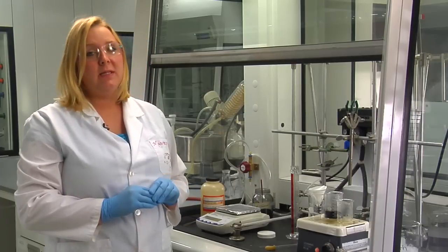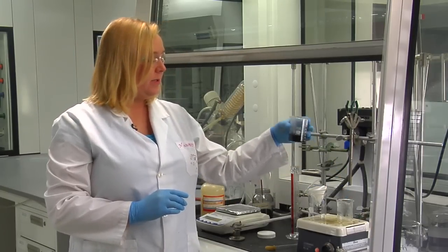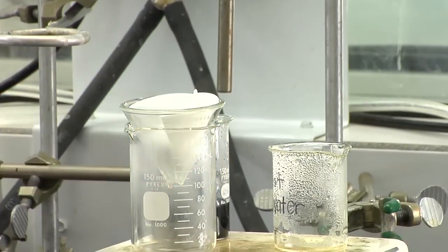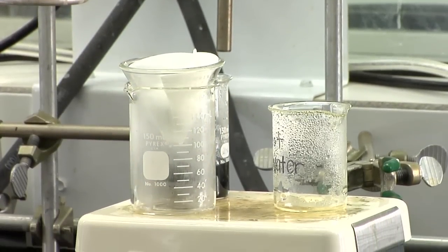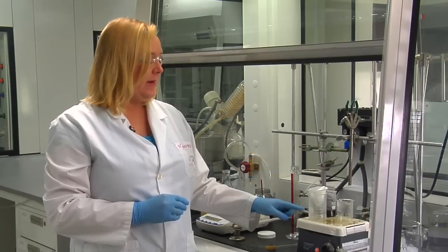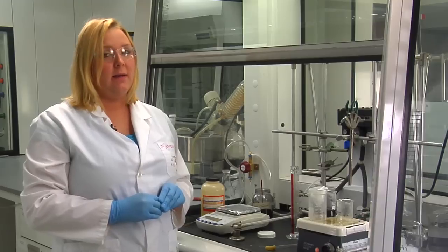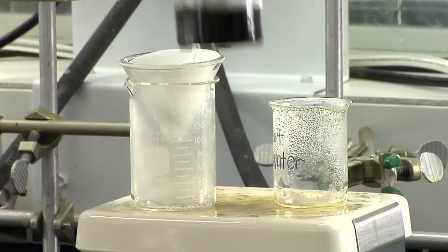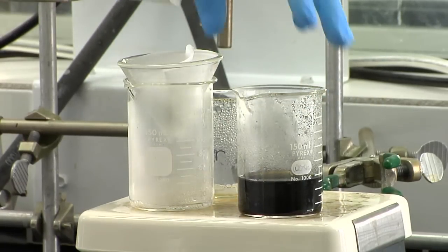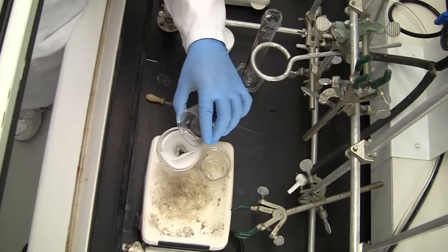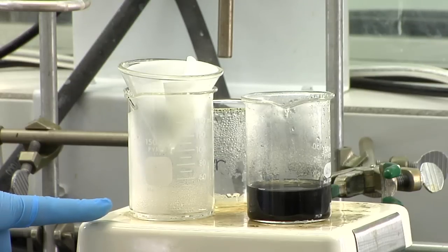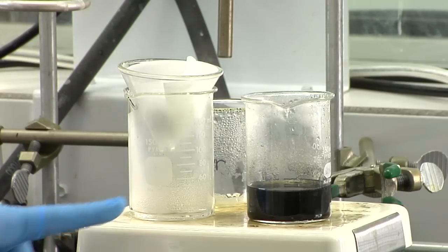Now slowly, a few milliliters at a time, we're going to pour our solution through the filter paper. Don't add too much at a time, otherwise the salicylic acid solution will cool and again precipitate on the funnel. We want to make sure that it goes through the filter paper into our beaker, so we have to keep it hot at all times. Make sure this is staying on the hot plate during this filtering. Continue to add a few mils through the filter paper at a time. You can see that the solution coming through the filter paper is clear. It has none of that yellow impurity and no charcoal.